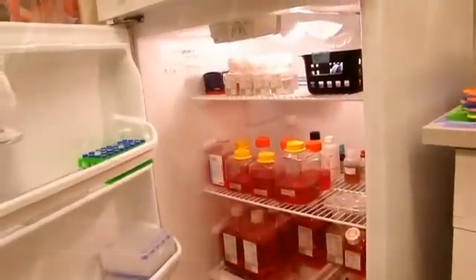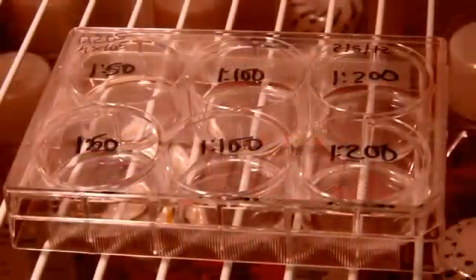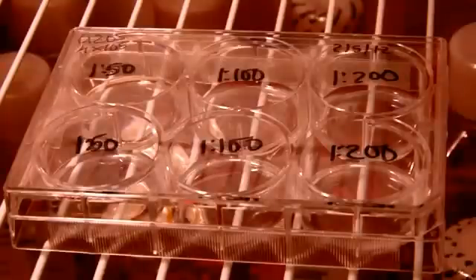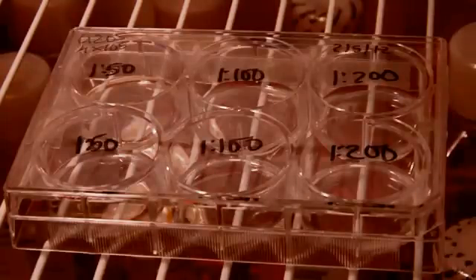Incubate at 4 degrees Celsius overnight. In our example, since we are using an unconjugated primary, we will be using a fluorophore conjugated secondary on day 2.